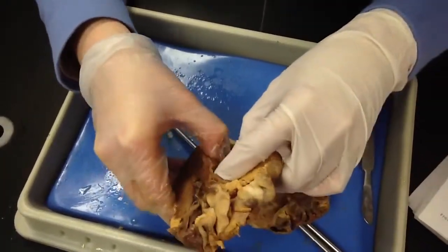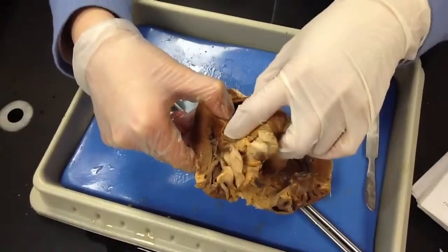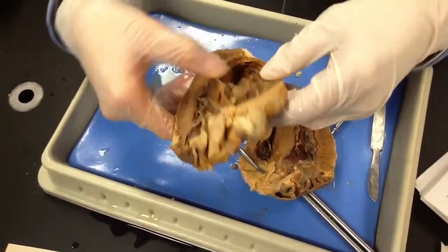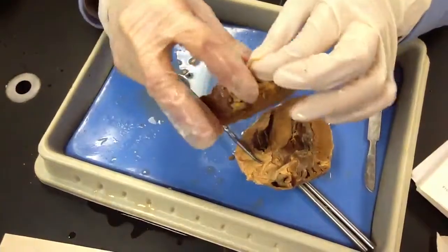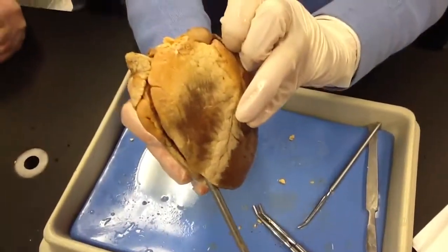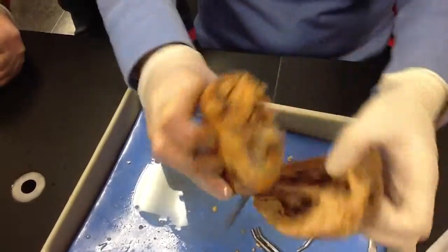I'm going to try to have them set up very nicely so you can see it. I'm going to dissect them out for you for the practical. I don't want to give you ones that other students have dissected, because sometimes people cut things a little weird and cut things off. Like this right here, see how it's supposed to go around to the aorta? Some things are just cut weird, but you can see it whenever I hold it together.